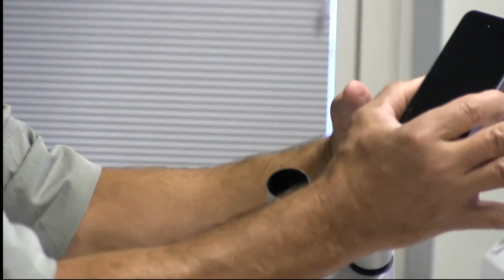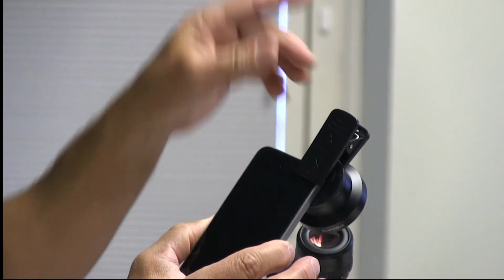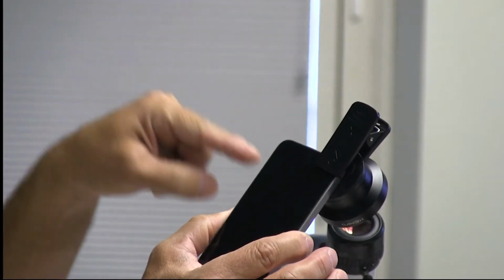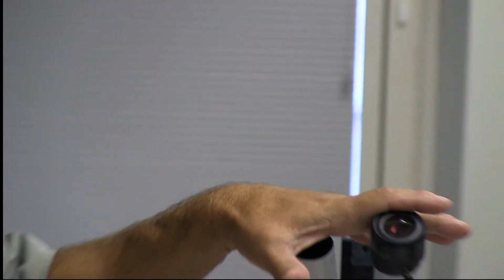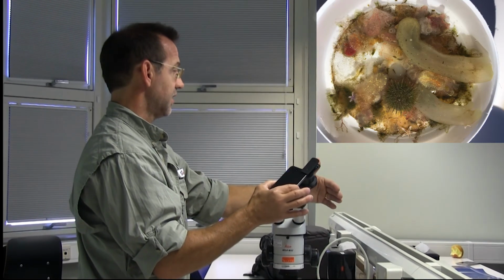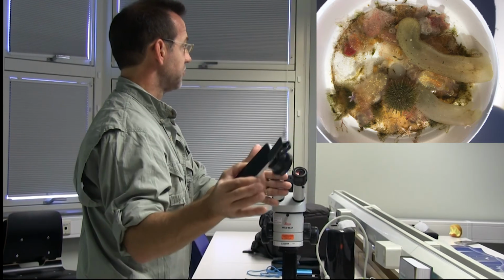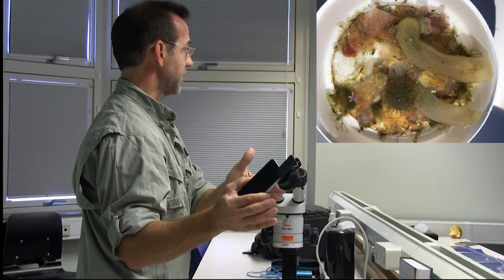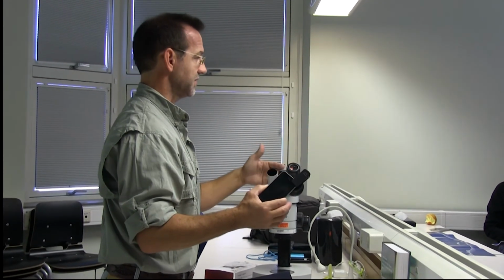And when you have a photograph of the whole disk, or video even, students can always go back and look and count things at a later time. So they could focus on looking and observing and then go back and look at recorded images or recorded video after. So that helps save you time and helps give them more time to look at a sample versus just one day or an hour or something like that.